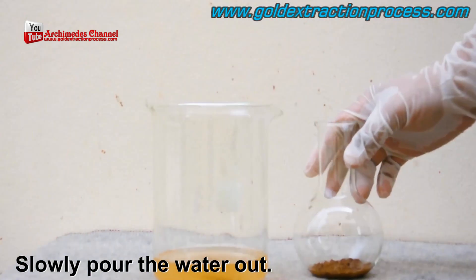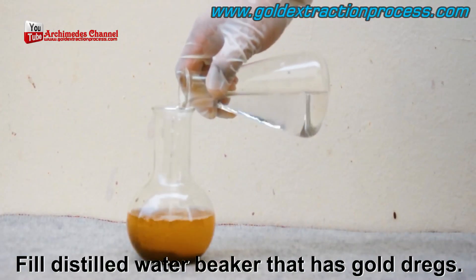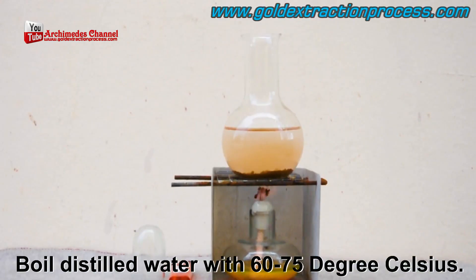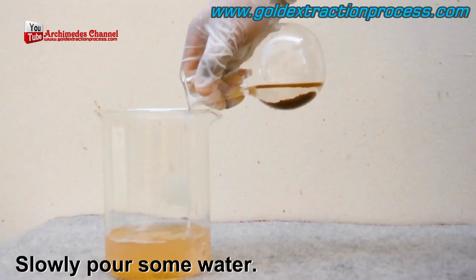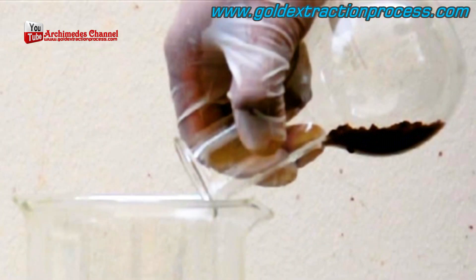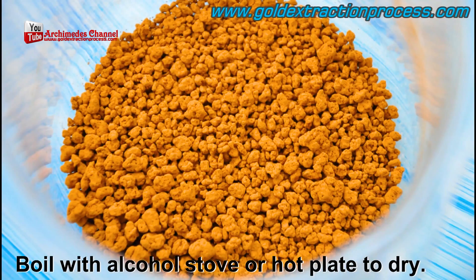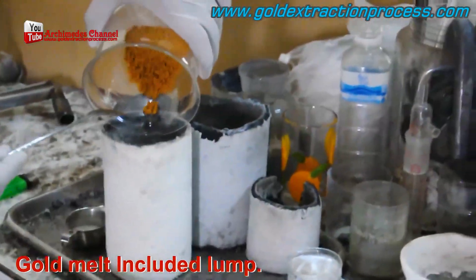Eventually you'll see some precipitate at the bottom — that, in essence, is gold dust. Carefully pour off the excess liquid, making sure not to lose any of those dregs at the bottom. Rinse them again with a little distilled water poured on top, allow it to settle, pour away the excess, add some more, and boil at 60 to 70 degrees Celsius before slowly pouring it out one more time, keeping that dust in the bottom of the beaker.